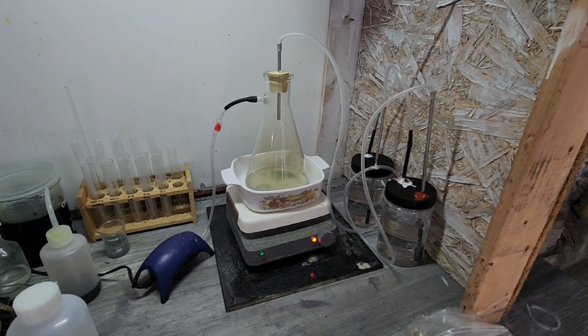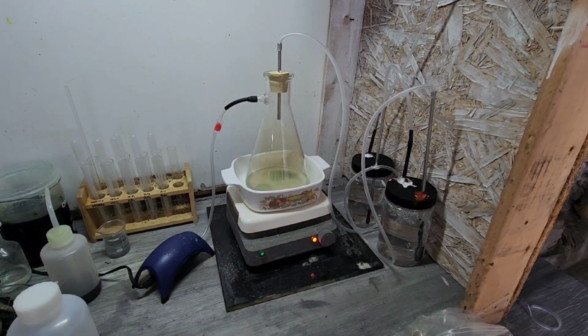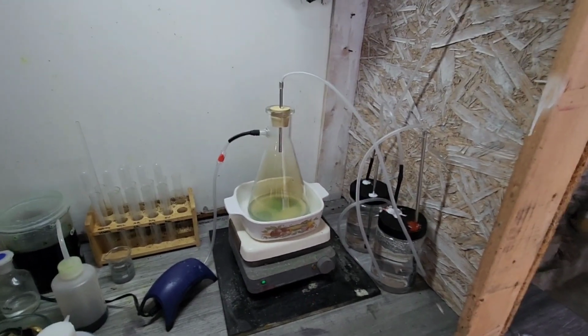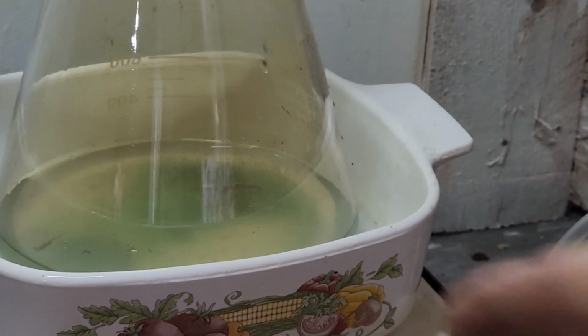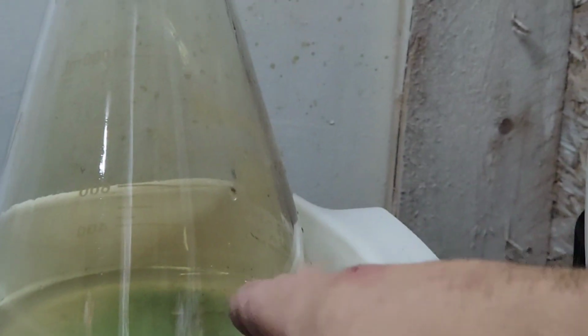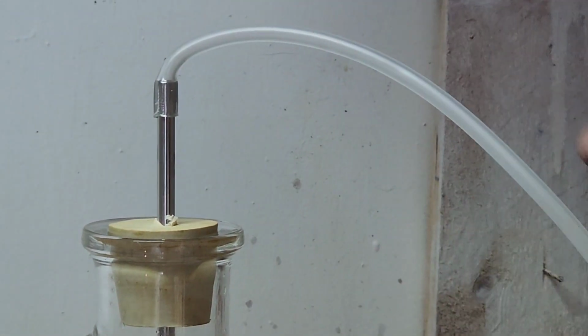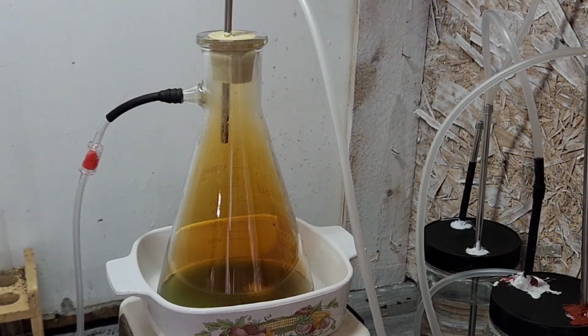So I loaded this up with nitric. I know it's way too much for the amount we wanted, but I wanted some really good fumes just so I could kind of see what's going on here. All right. Probably going to have to put you on hand mode here. So we got a pretty good reaction in there. We got some good fumes going on. Still pretty clear coming out of the tube, though. And it's clear coming out there as well. All right, so we got good fume action going on.